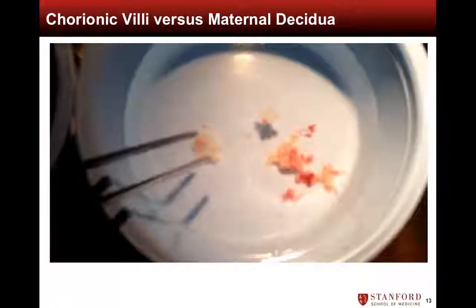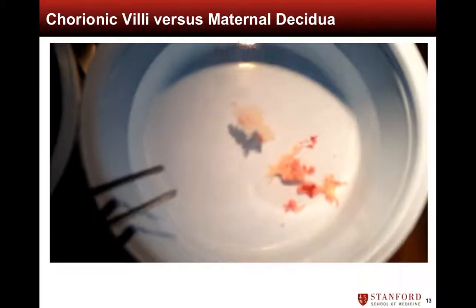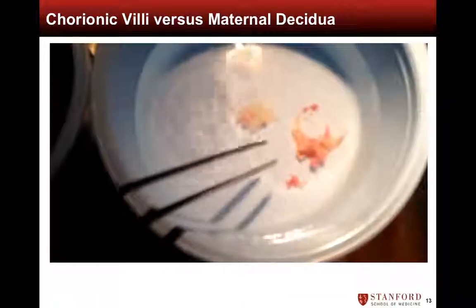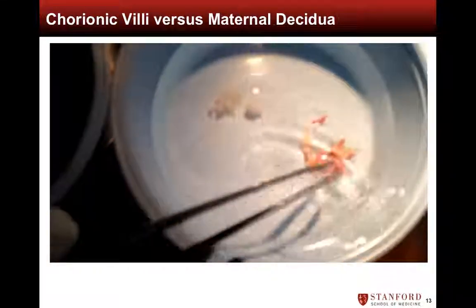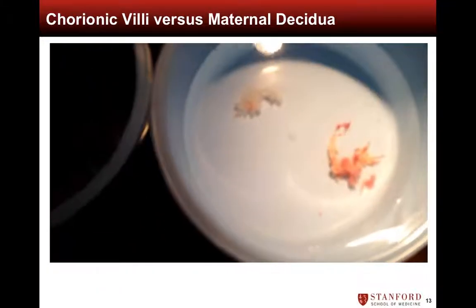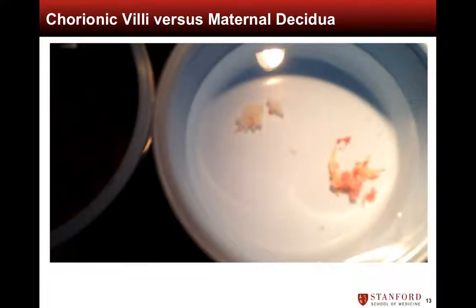Identification of villi and decidua can be further confirmed by comparing the densities of the two in normal saline. The villi on the left float, while the decidua on the right quickly sink.